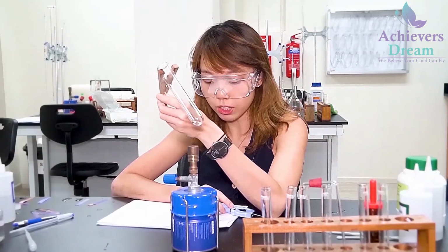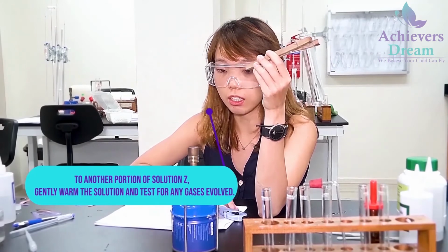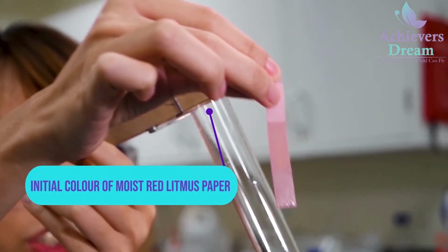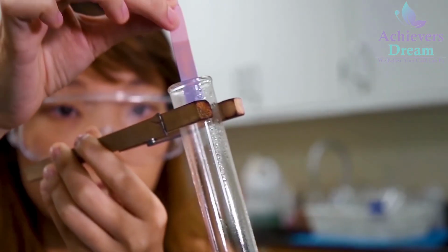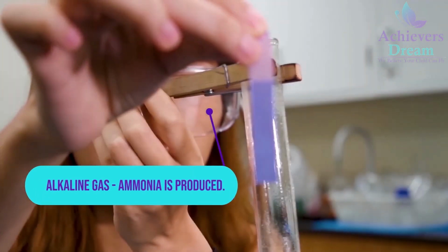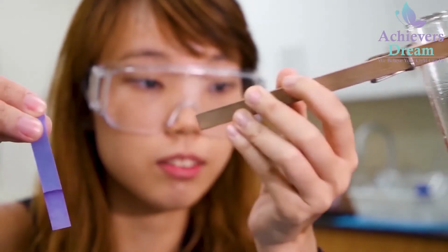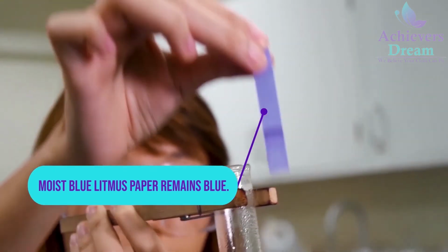Okay, so for B part 2, to the second portion in your boiling tube, I'm going to gently warm the solution and test for any gases evolved. First I'm going to use the moist red litmus paper test. So this is the initial color. Your red litmus paper has turned blue. Okay, so I'm going to do the same for your moist blue litmus paper. So this is the initial color. And it still remains blue.